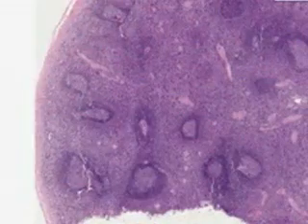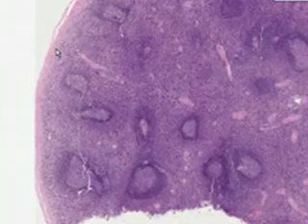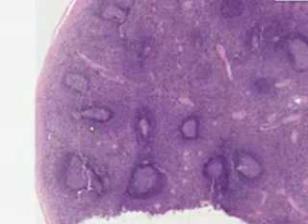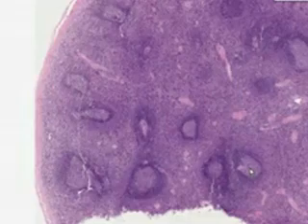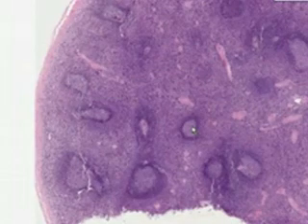Here is some more lymphoid tissue, as you could see. In fact, it appears to be an actual organ because you could see a fibrous capsule composed chiefly of fibroblasts and collagen at the periphery. And then you could see all these lymphoid follicles. And they are secondary follicles because they have germinal centers on the inside and darker lymphocytes on the outside. And it looks like it's primarily a lymphocytic organ.